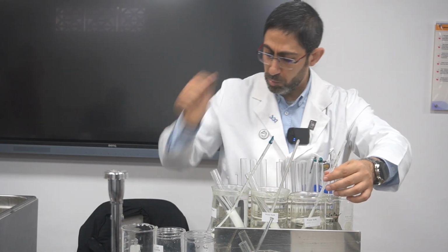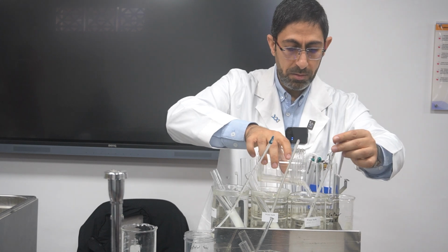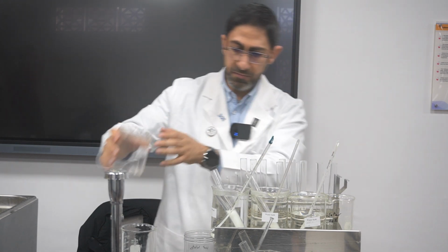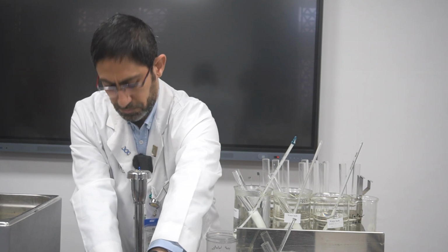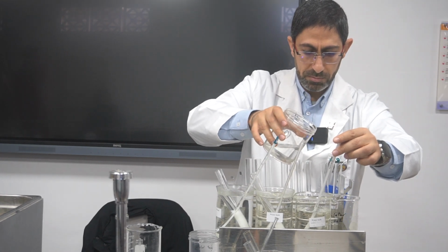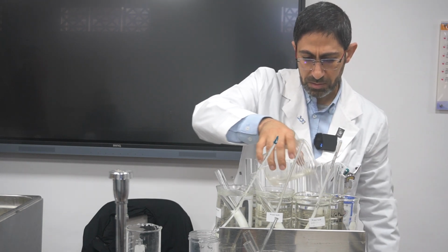I will use the tap water. Yes. Yeah, now it is decreasing. Still above, between 40 and 50. I need it exact 40. 45. Yeah, now it is 40. Okay.